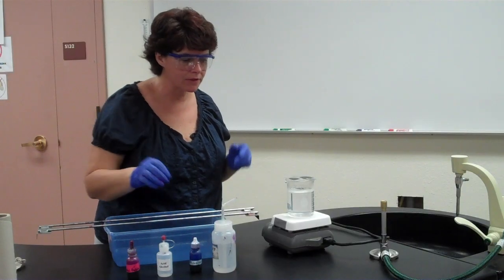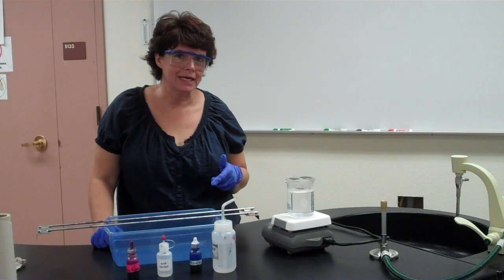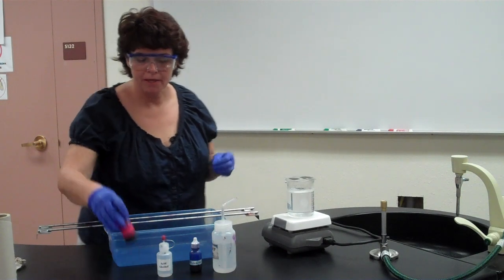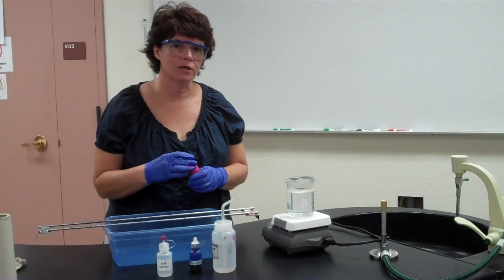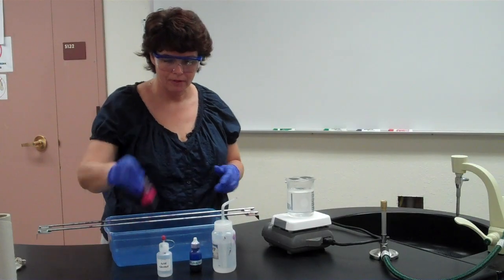Now remember with the gram stain, purple was positive, red or pink was negative. So you need to be thinking independently when you talk about a stain. Some people automatically think red is negative, and they put the gram stain and acid-fast stain together. They're completely independent of one another. So red in this case actually means positive, okay?